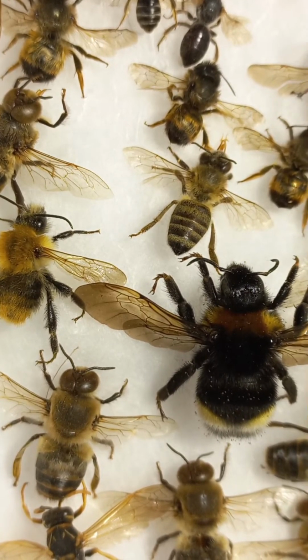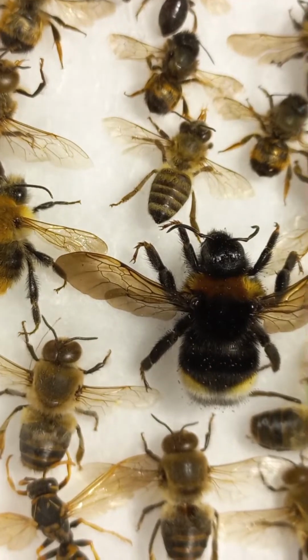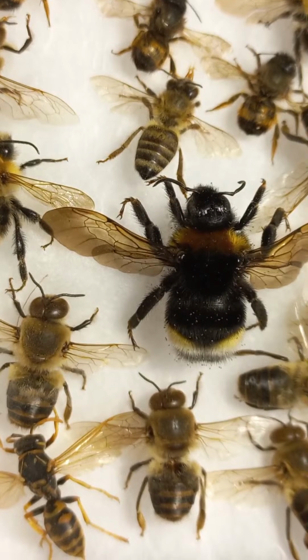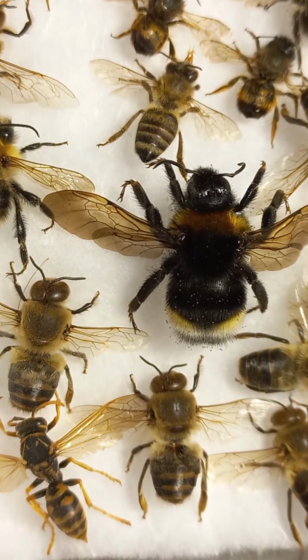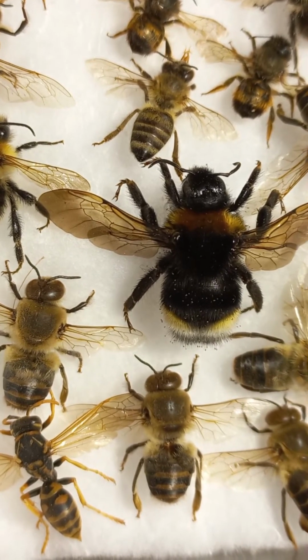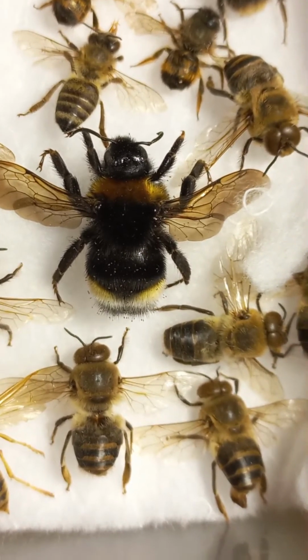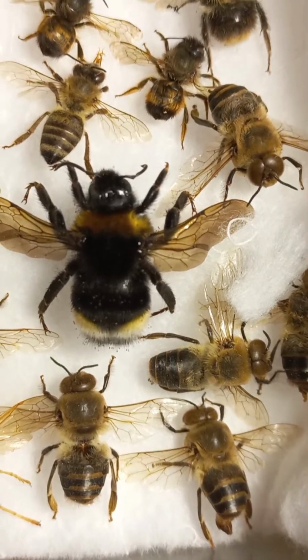I will show them under the high magnification of a microscope in my collection jar. Today we'll be talking about terminology, which is quite similar for different apids, for wasps, for bees, for parasitoids. The structure of head, thorax, abdomen, wings, and legs is quite similar. For beekeepers, it's the most important to know more about honeybees, but the structure of a honeybee is quite similar to the structure of solitary bees.